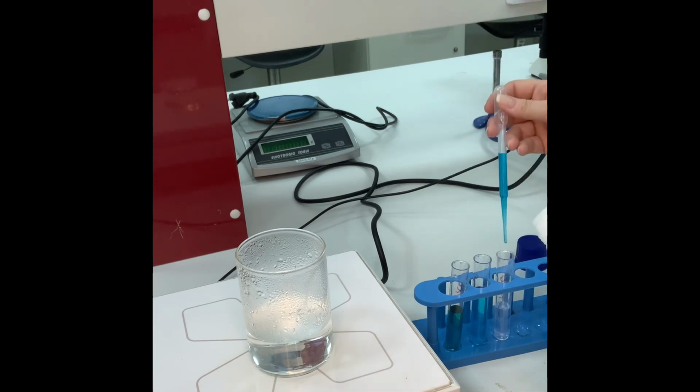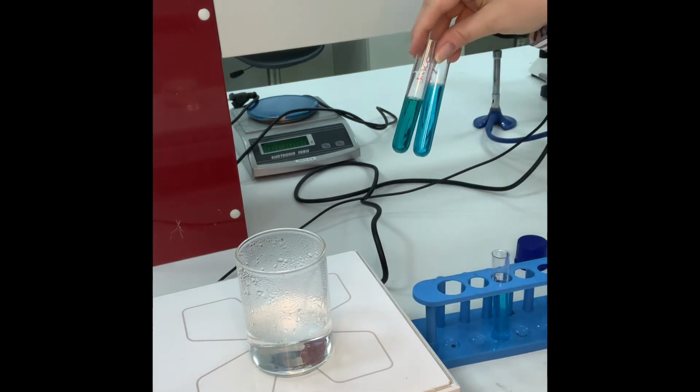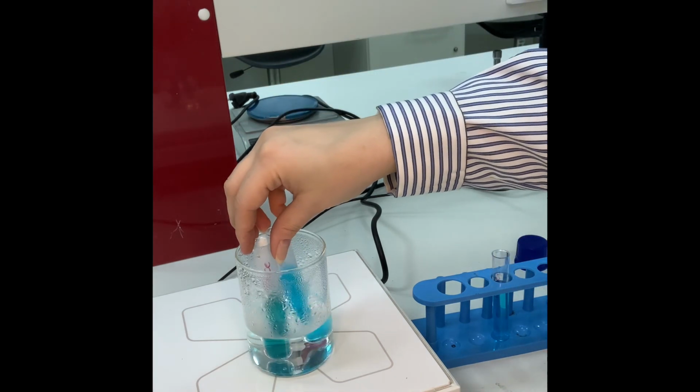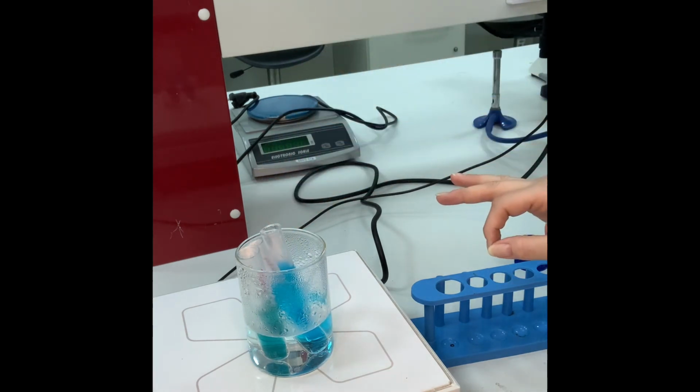Now why do we have to have negative and positive control? For accuracy. Why do we have to have a very accurate measurement? Also for accuracy and precision, to have an accurate and precise coloration. So very simple. Now there is nothing changed over here, but I will add it to my hot water bath, and I will wait for 5 to 7 minutes for the target result I'm looking for.